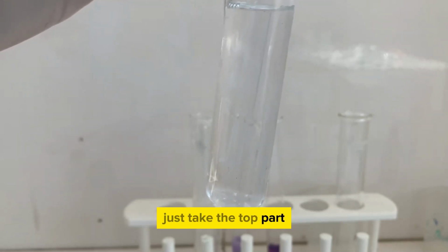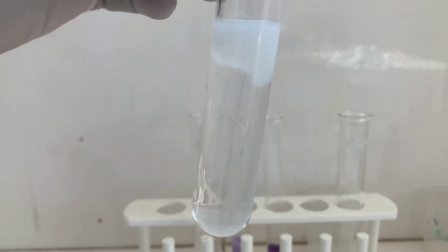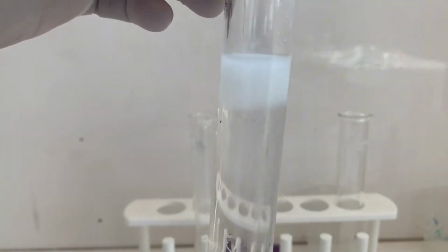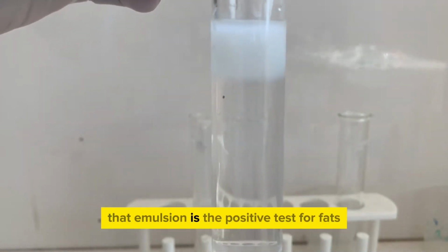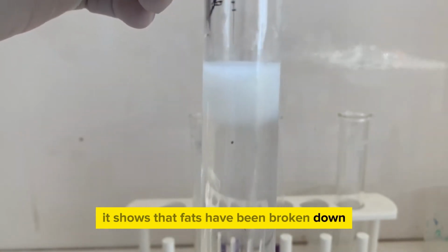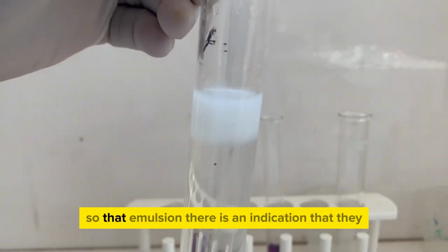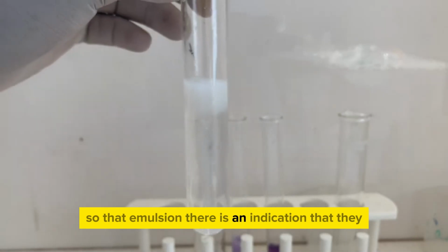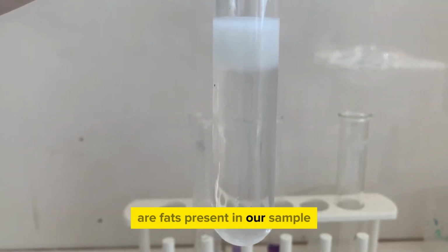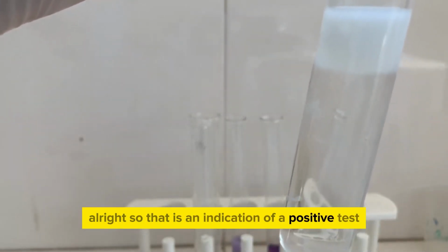Just take the top part, don't add solids to the water. Take note, when I pour only the liquid part, an emulsion forms. That emulsion is the positive test for fats. It shows that fats have been broken down and it forms somewhat a cloudy white on top. So that emulsion there is an indication that there are fats present in our sample. So that is an indication of a positive test.